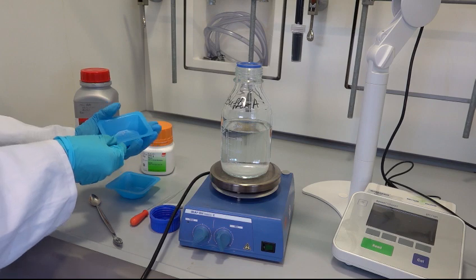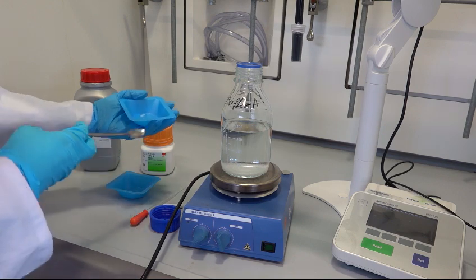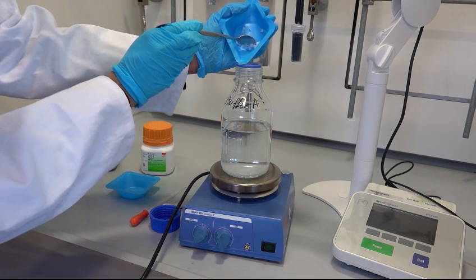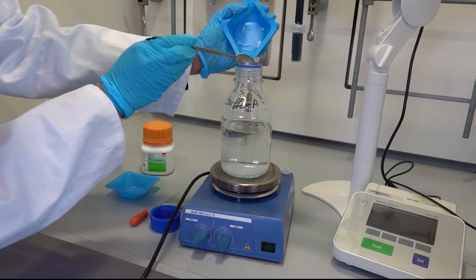When adding sodium hydroxide, use a spoon as due to pressure change in the fume hood, granules might melt and stick to the walls of the vessel.